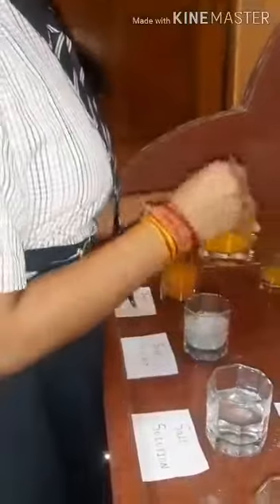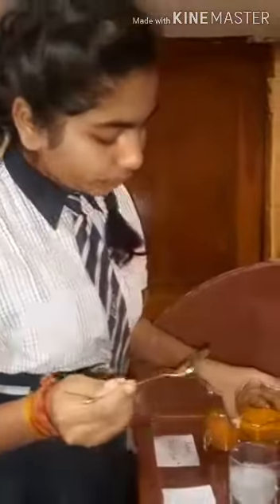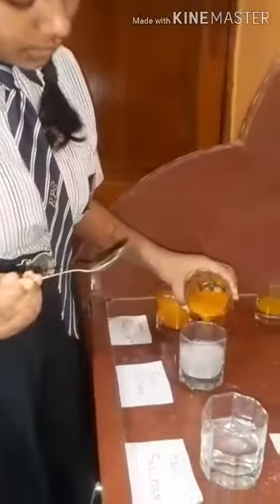Then the second one is the soap solution. We will stir it very well and after that we will pour it into the soap solution.